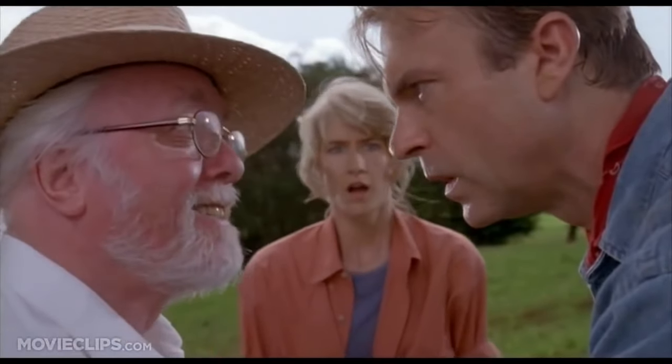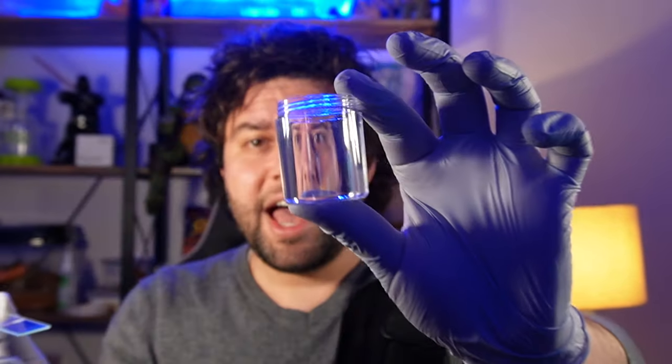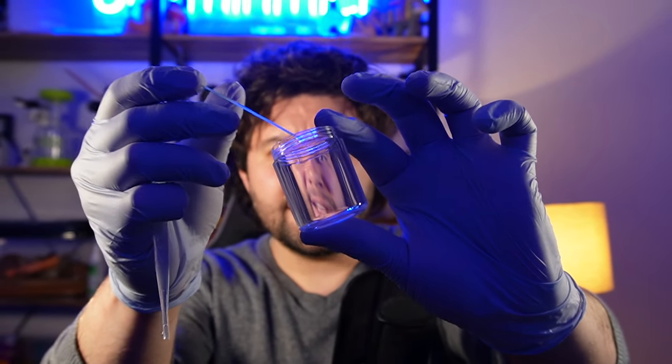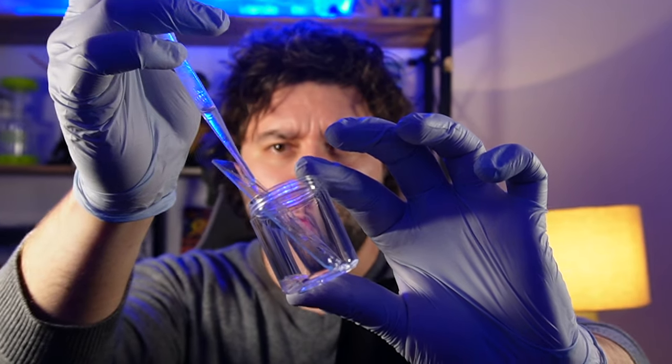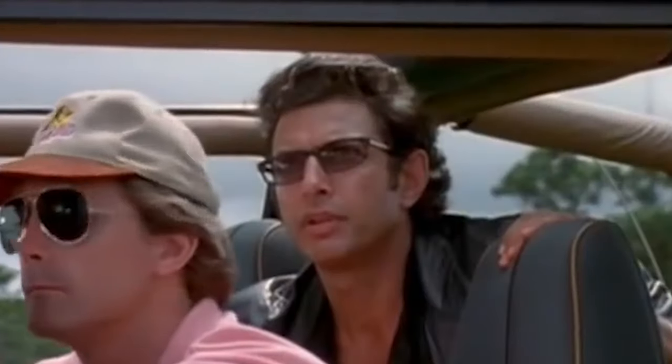We have a t-rex. So I took a glass jar and in this jar I put the glass slide. I then carefully rinsed the slide using distilled water, then added some steamed rice to feed whatever's in there. You crazy son of a bitch.